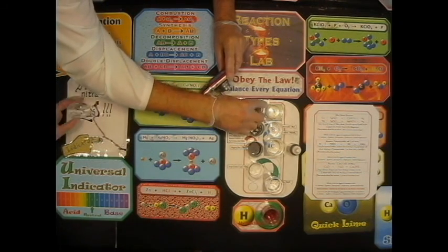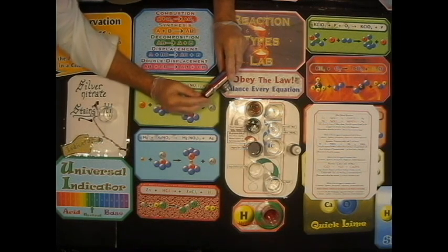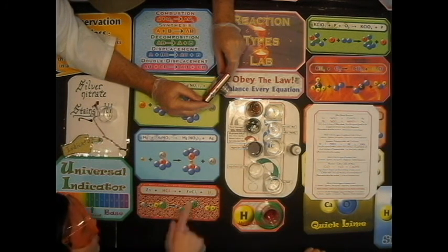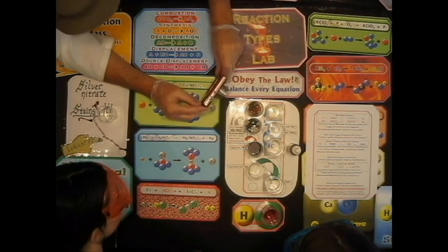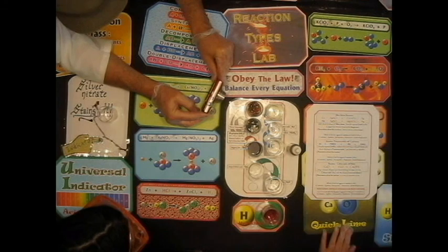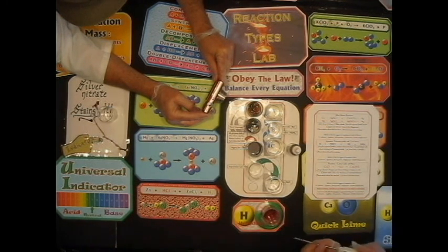So let me turn these so that that's not blocking. Let's see what kind of reaction we get here. So do we see any signs of a chemical reaction? Any signs of change? Not yet. This one's fizzing very slightly though. Don't you notice any sort of color changes? Oh. This one's the copper and this one is the magnesium. Yeah, on the copper it's getting darker. Darker, right? Yeah, but the above it is just normal. Well, let's see if there's a change of temperature. Lucy, see if there's a change of temperature in the copper one.